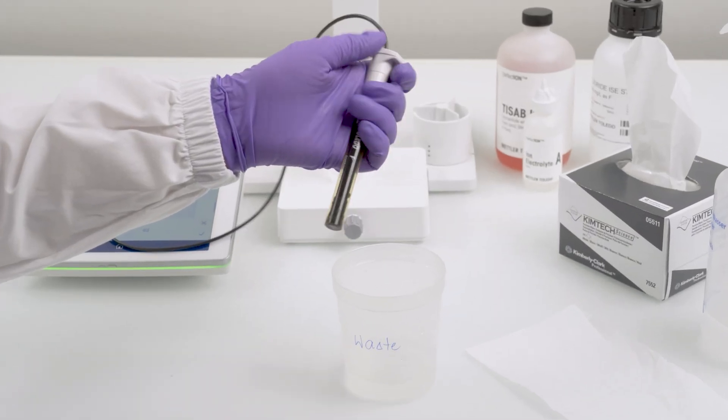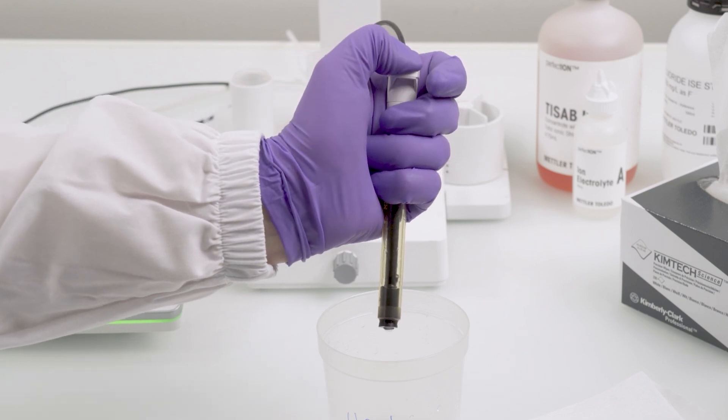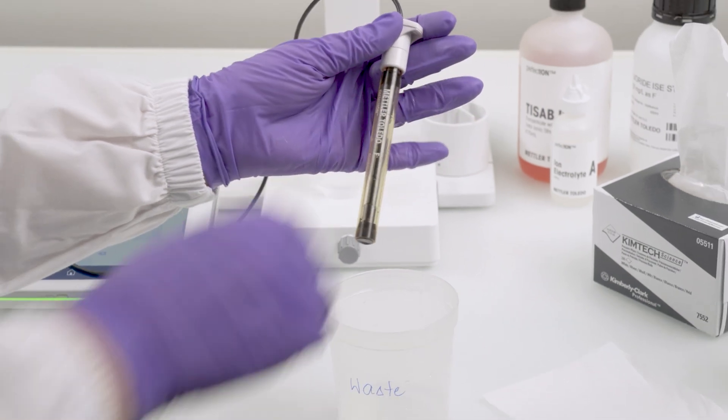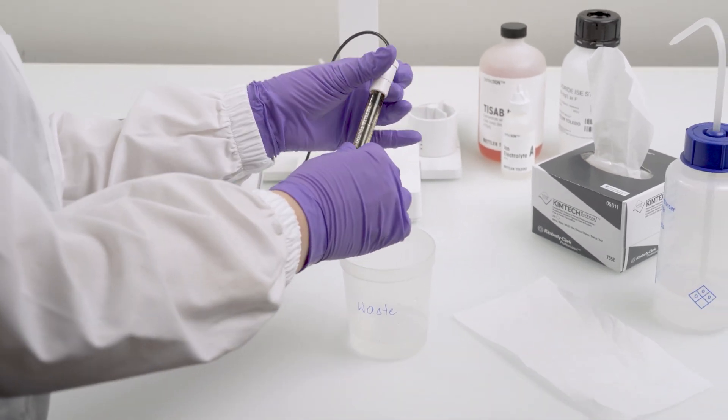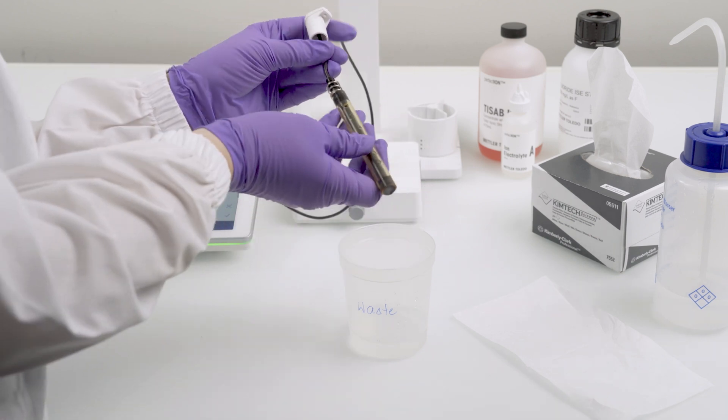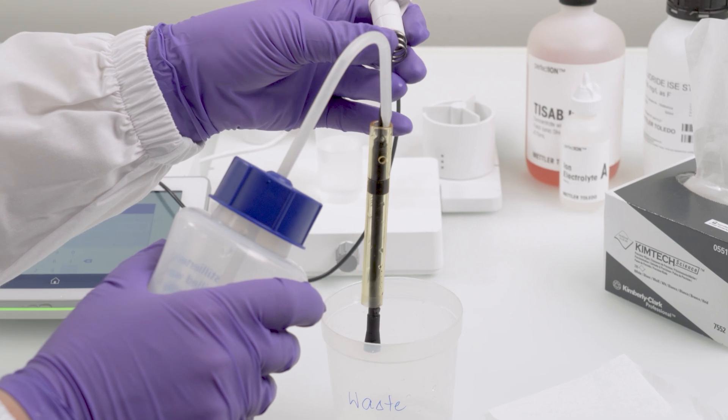To drain the electrolyte, use Click & Clear. Be careful not to touch the reference electrode when cleaning and reassembling. Clean the inside with distilled water thoroughly.